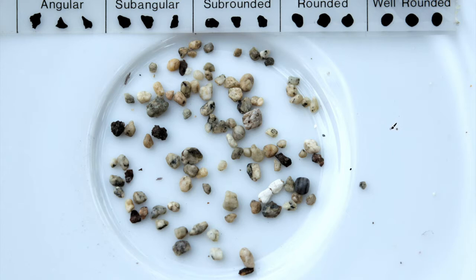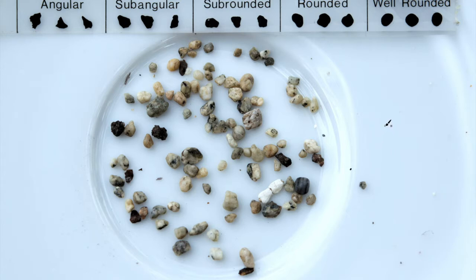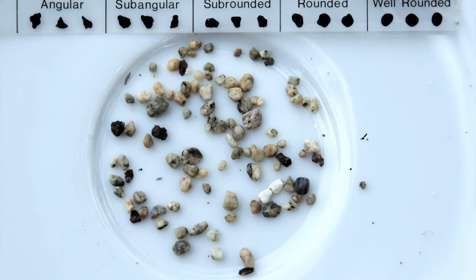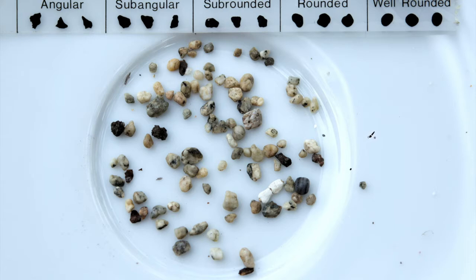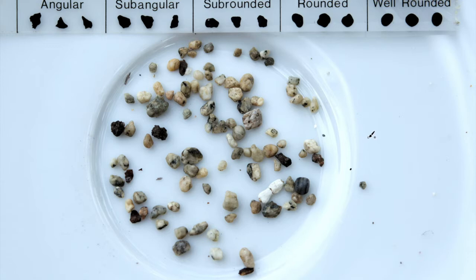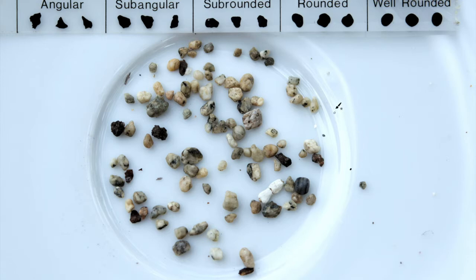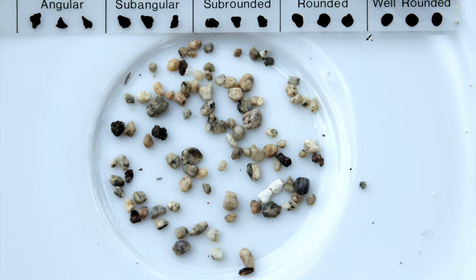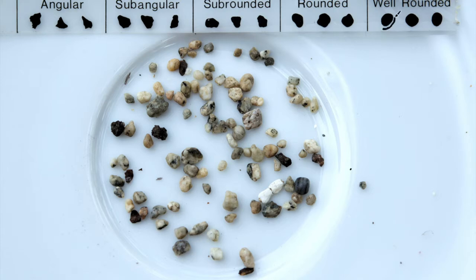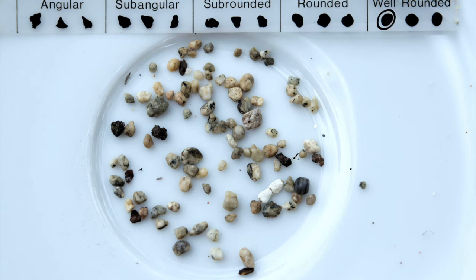Here are a few grains from our Bodega sample. You can tell that they have a variety of compositions by the differences in color, and they have different amounts of rounding. We have the grain size chart at the top which shows the rounding, and we'll start by looking at some well-rounded grains.